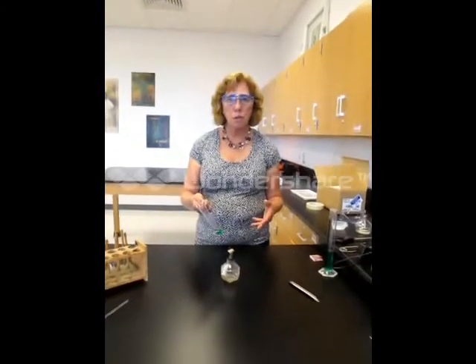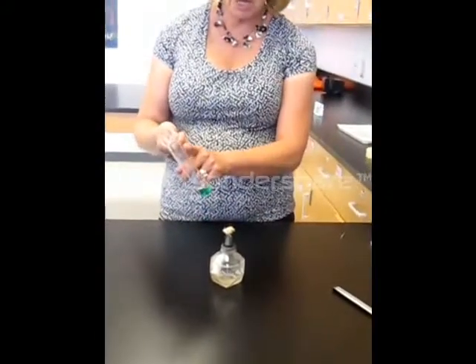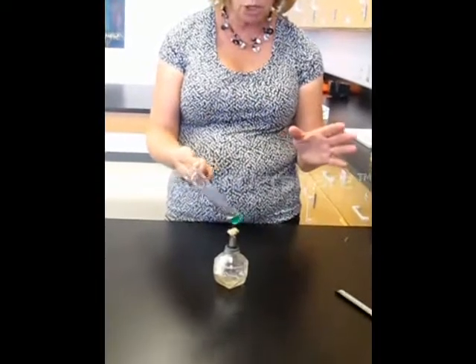Sometimes we don't use a hot water bath to heat a solution. You may have a solution in a test tube that you are going to heat over an open flame. We have an alcohol burner here, and I have my test tube in my test tube holder. As you are heating the solution, you have to be sure the opening of the test tube is not directed at any other person in your lab group or across the table. I am moving this test tube back and forth across the flame of the alcohol burner, because if I hold it in one spot that part of the solution will start to boil before the rest, and the bubbles can literally bounce the solution out of the test tube. Be sure you are moving the test tube back and forth and that it is not pointed at anyone.